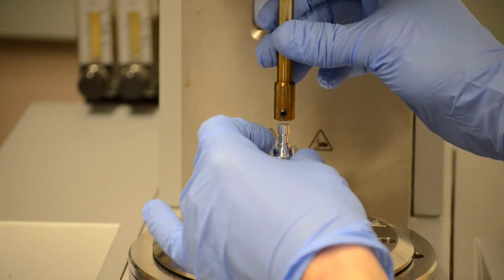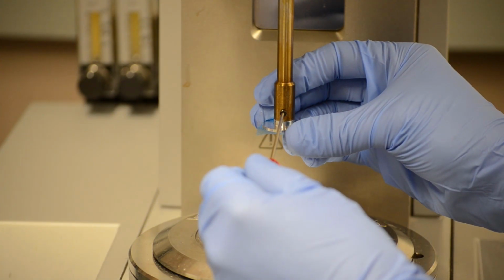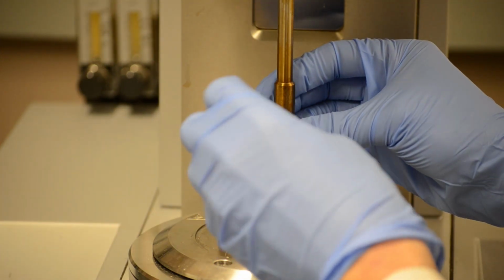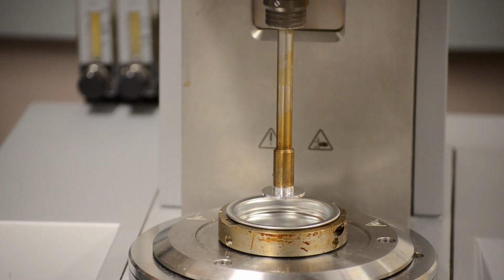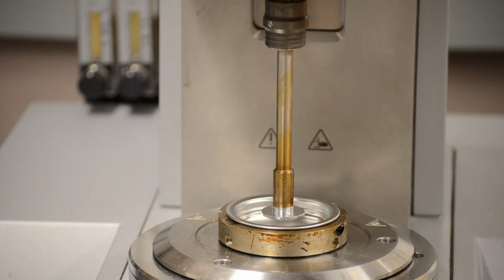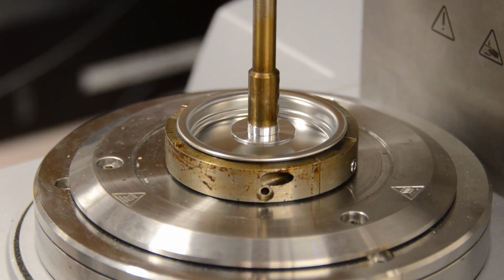The selected measurement systems are installed in the rheometer spindle. The rheometer spindle's angular position is precisely recorded with an optical encoder. The vertical position of the spindle is also precisely measured and controlled to maintain a constant and accurate gap between the measurement geometries. This ensures consistent and repeatable results over a range of temperatures.